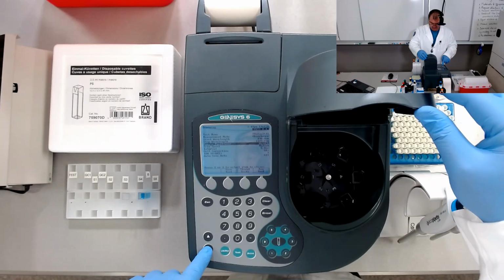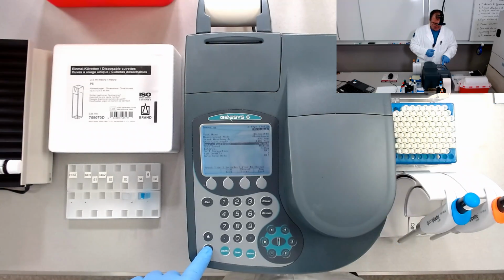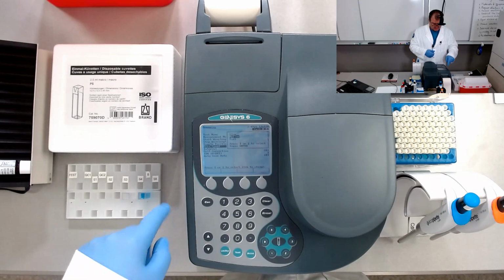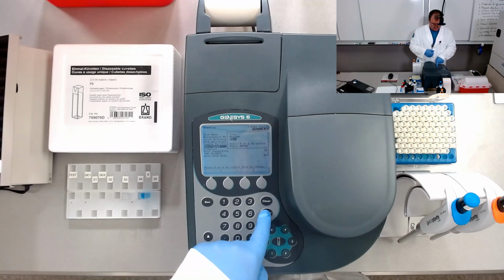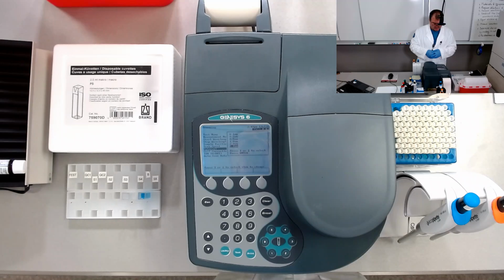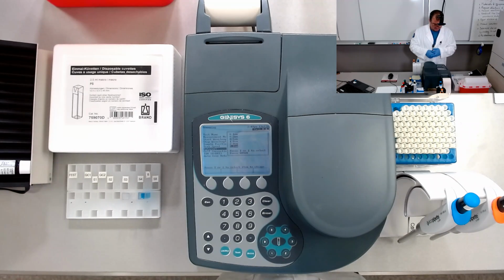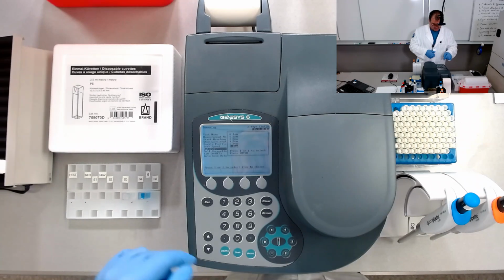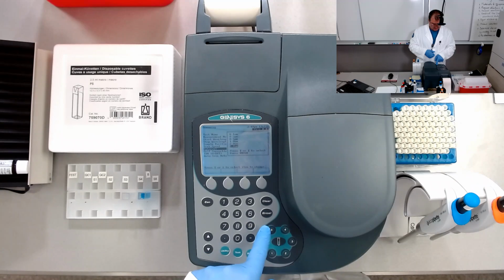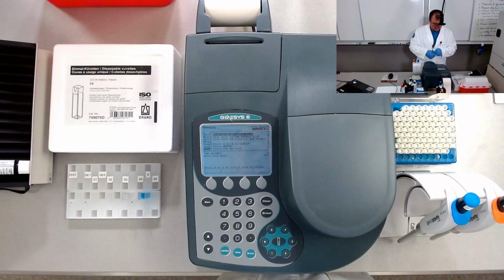We have a carousel of 6 positions, 5 for samples, 1 for blank. For scan speed, let's go in a faster mode, let's say fast. For interval, we'll take the absorbance measurements using 5 nanometers in between, right? So a step of 5 nanometers will be sufficient for our procedure here. Okay, so save test.